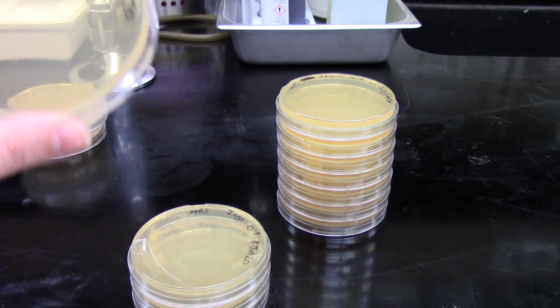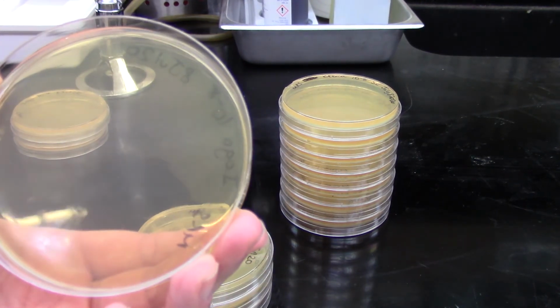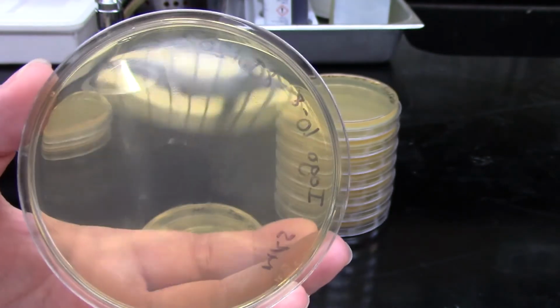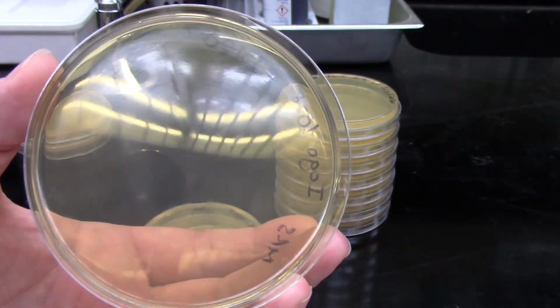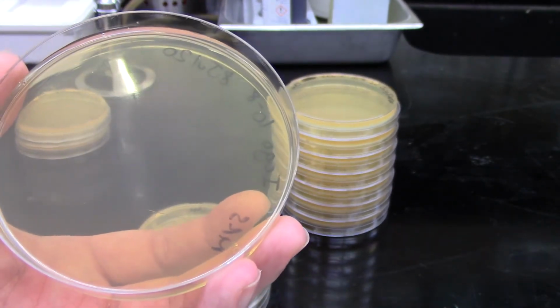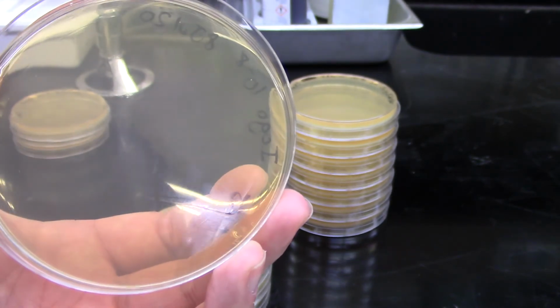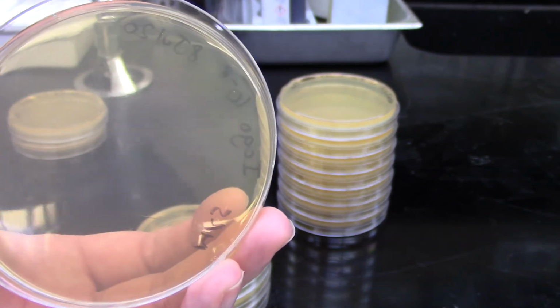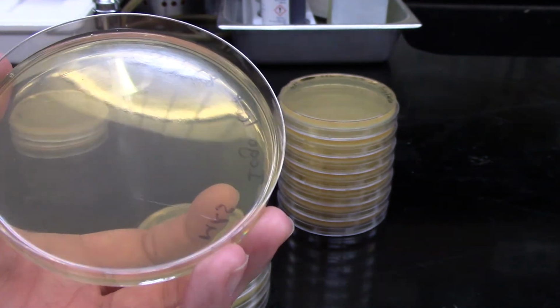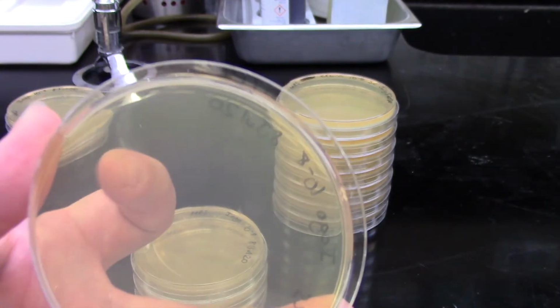And then if we look at our 10 to the minus 8 plate, we're really not seeing any growth at all. There might be a couple of colonies off to the one corner. Actually, I think those might just be bubbles, which makes sense. This is 10-fold more dilute than the previous plate, so in theory, if that previous plate had about 20 colonies, we would expect this one to have somewhere around 2 or 3. And it looks like that's exactly what's actually showing up. I can see that I've got 2 or 3 colonies over on this side here.